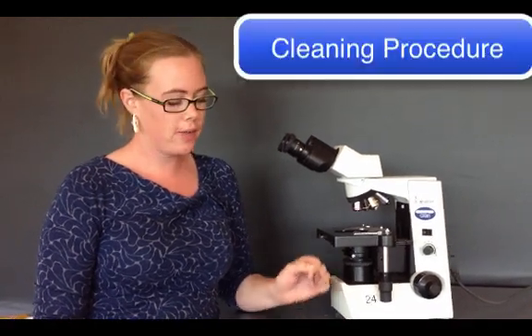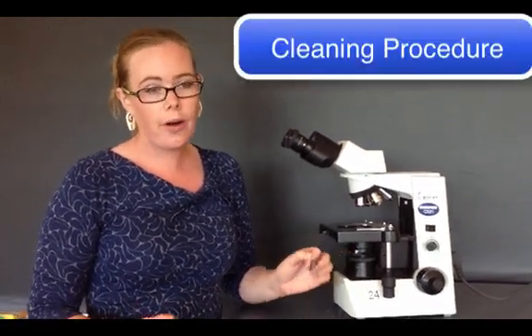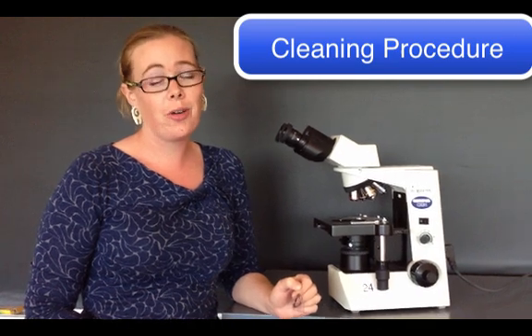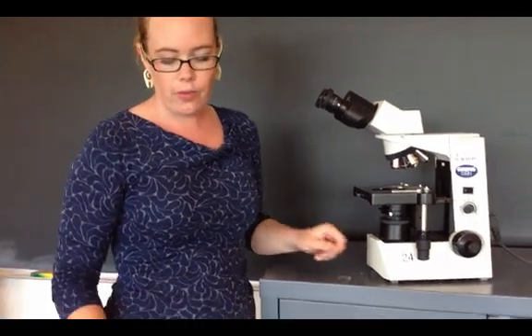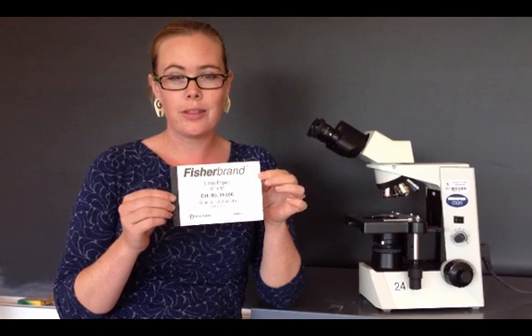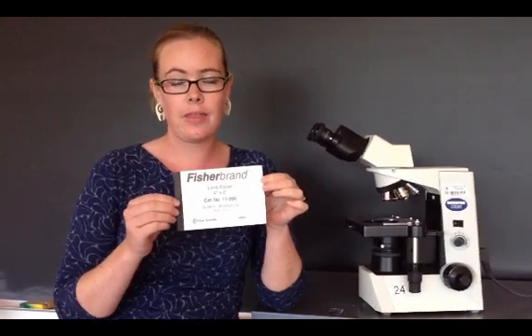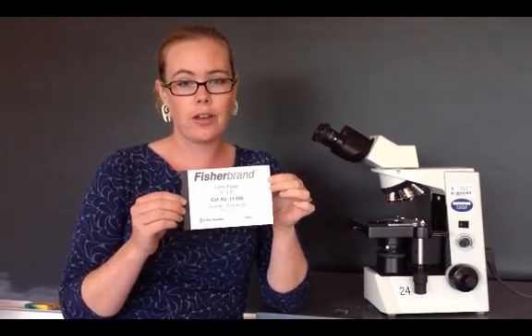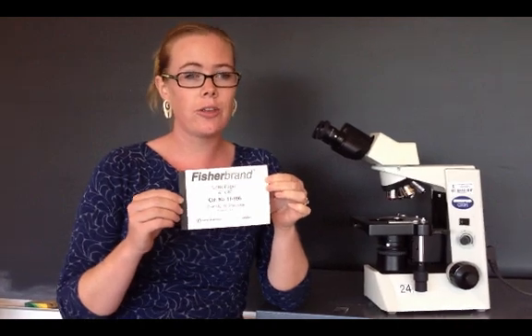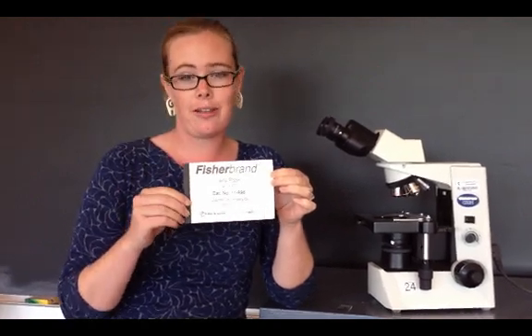When you've finished using your microscope, if it got dirty, or maybe you pulled out your microscope and somebody else didn't clean it up and so it's messy for you, there's specific things you need to know when cleaning either the slide or the microscope. The first thing is that you only use lens paper. This is going to prevent scratching of any glass, just like you use something special to clean your glasses.